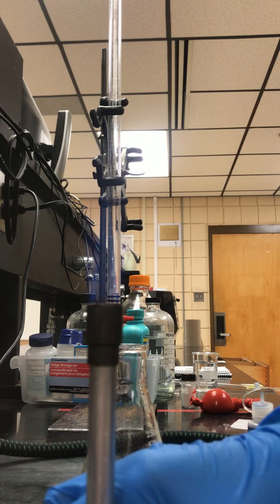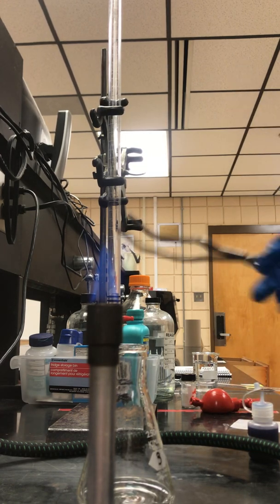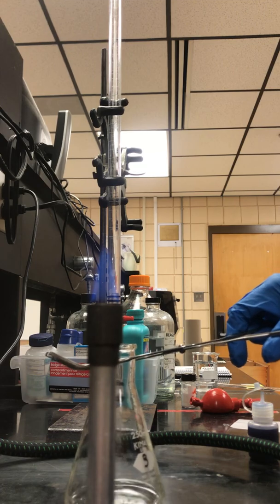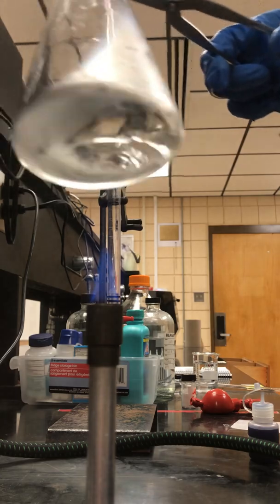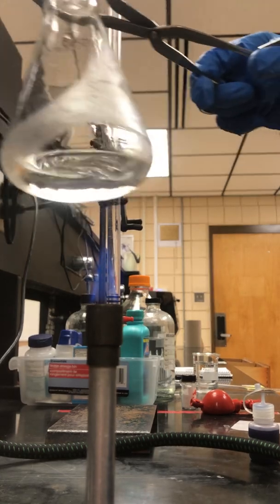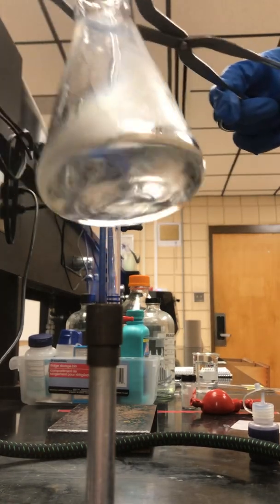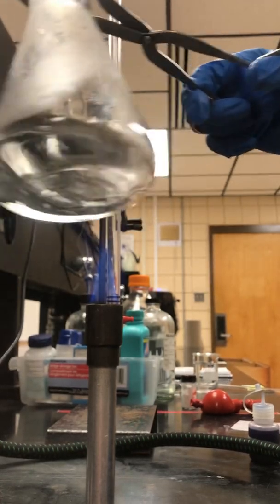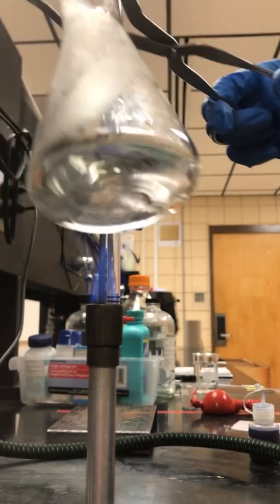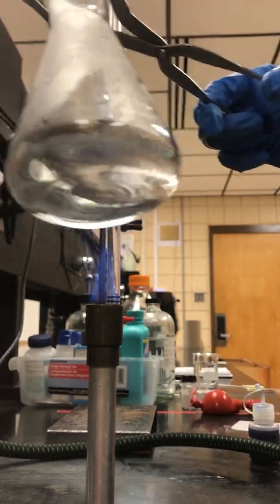You'll notice you see your cones so you can see the cool and hot zones. Gently grab the Erlenmeyer flask and gently swirl it around. You want to heat for about a minute, constantly swirling so you are removing the carbon dioxide.